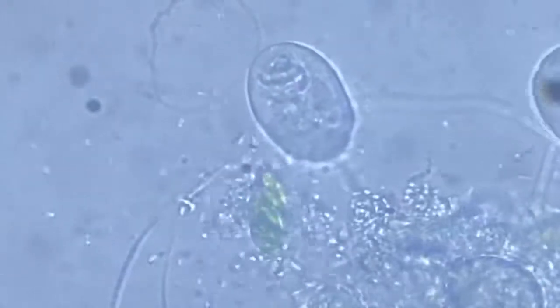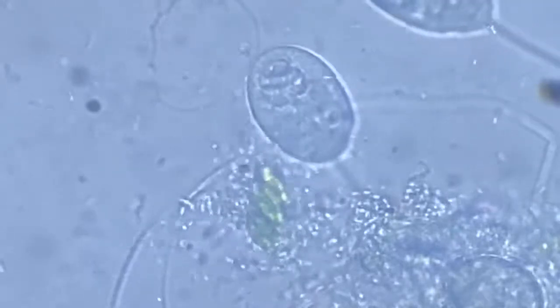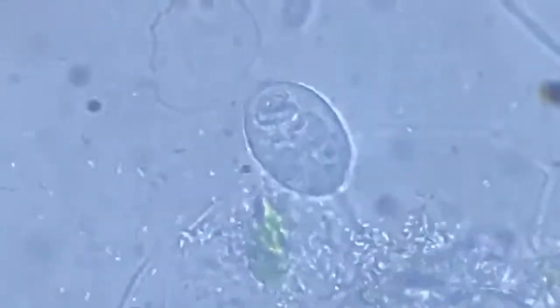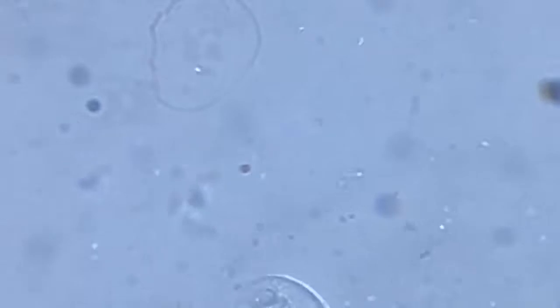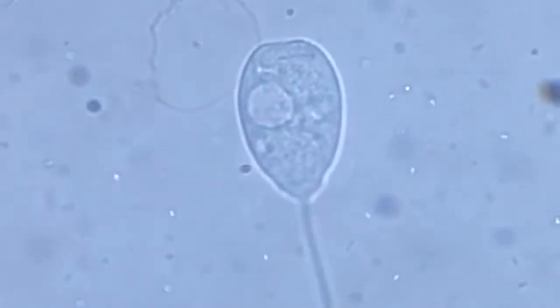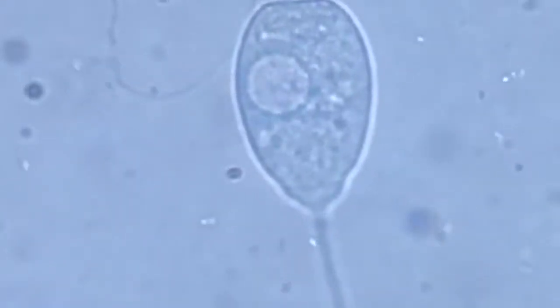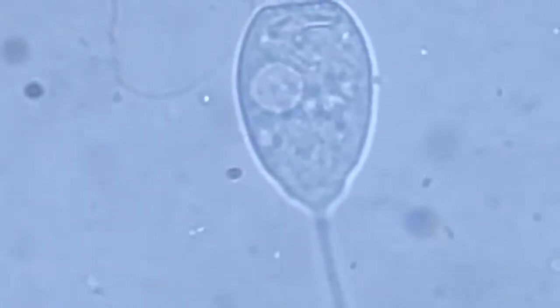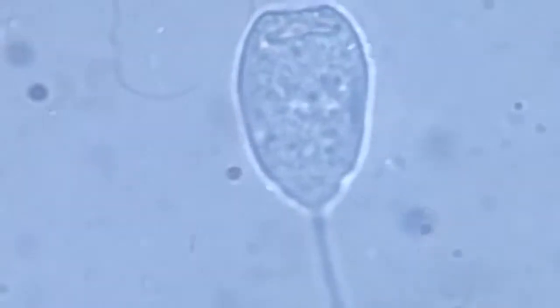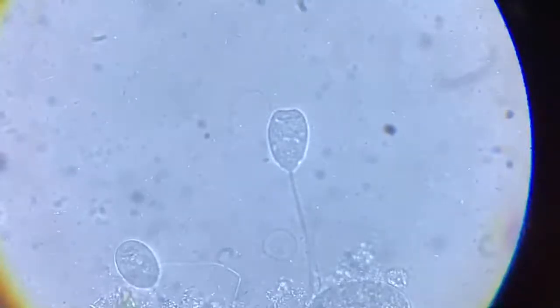That was it. It vacated itself, shed off some extra water from the body, and so will he. So shall he any second from now. There. So beautiful. Such a basic mechanism.